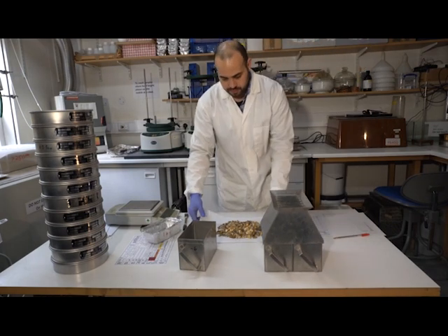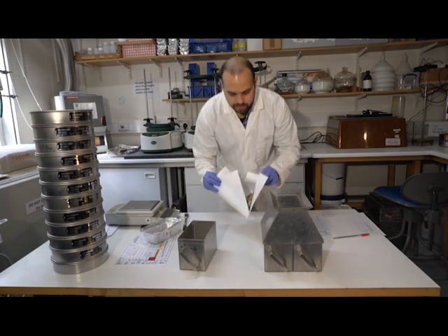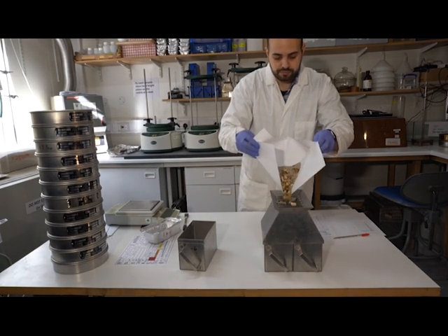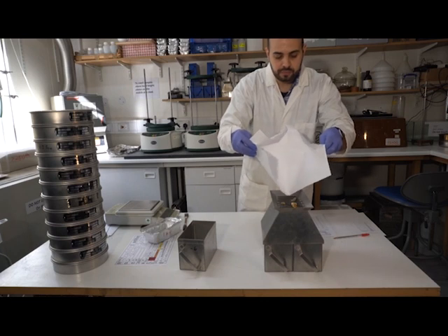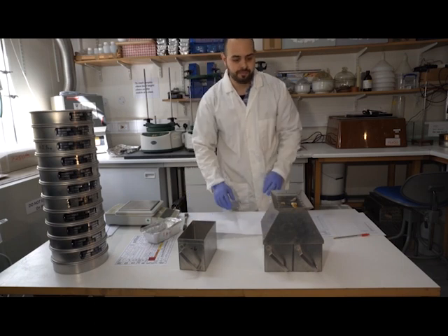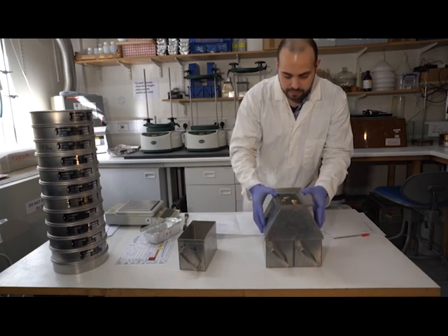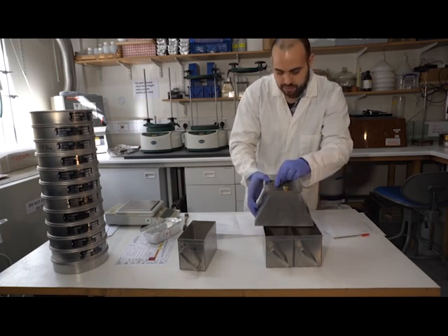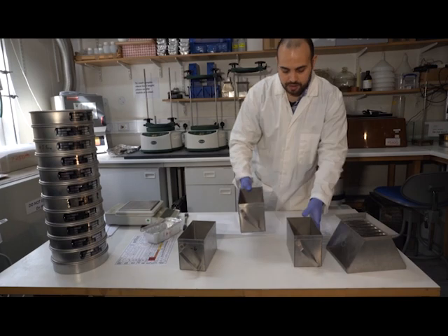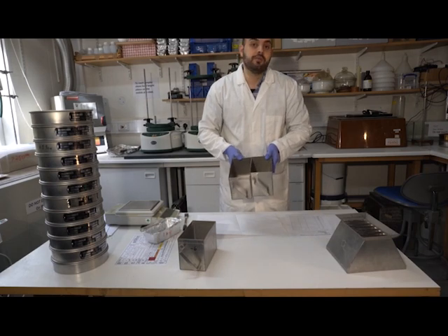Now what I want to do is, hopefully without losing my sediment, pour this across. And we can see some particles didn't go through, but I can just about guess that this would have gone here, this here, this there, and this there. And now I have 2 samples that have been randomly selected, so I can do my analysis.